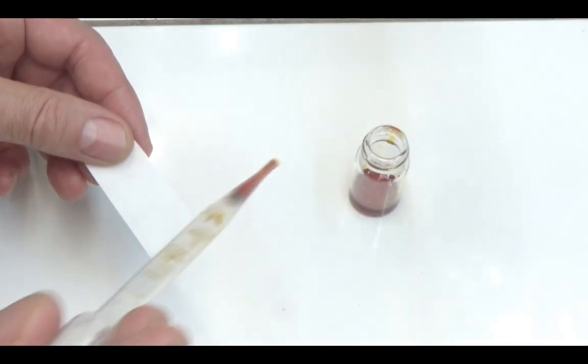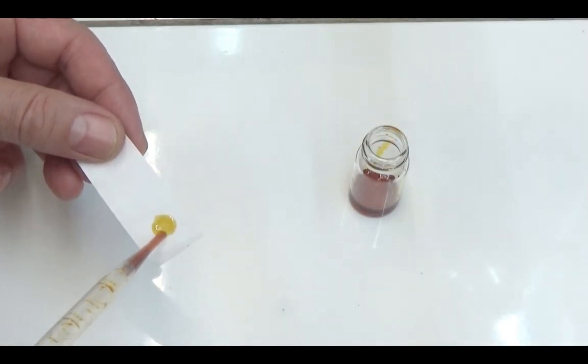A thick red oil with a faint strawberry aroma has been obtained. To increase the smell, add a drop of ester to a piece of paper and let it dry.